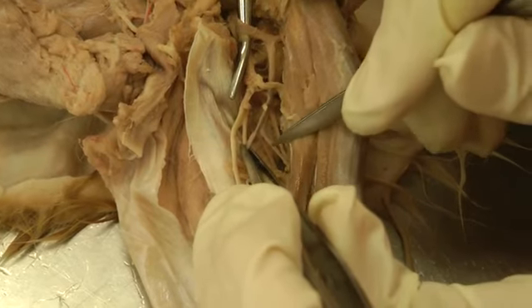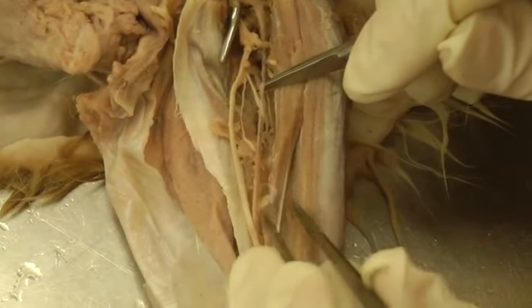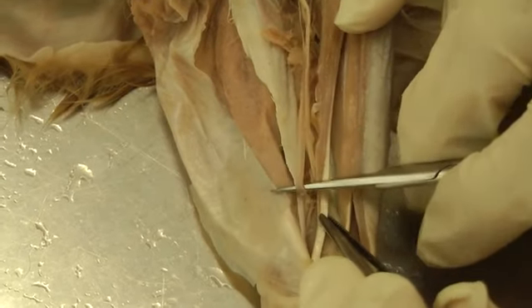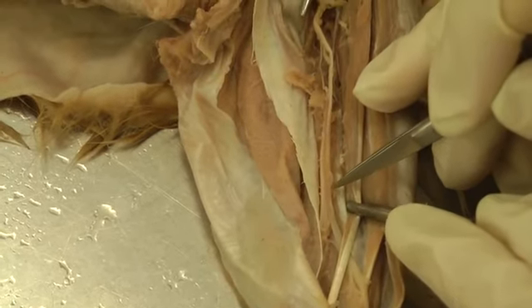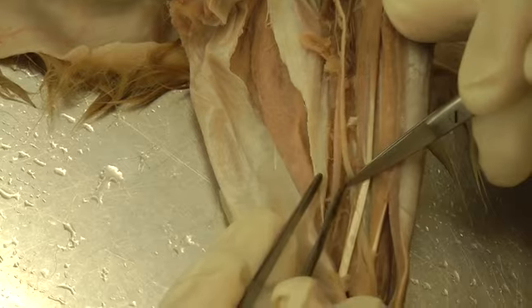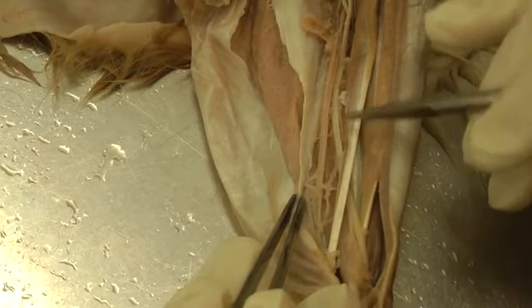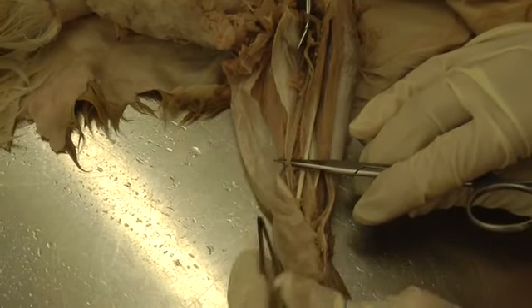After the caudal interosseous comes off, you will call this the median artery, traveling down towards the paw. But in the cat, the radial is the larger continuation, going cranially. I could not find the continuation of the median — it apparently got so small it just disappears. If you have one and can follow it, that would be great to see; call a professor over. But for sure identify the radial in the cat, as it is important that it is bigger and goes cranially.